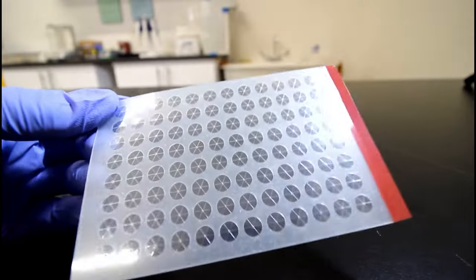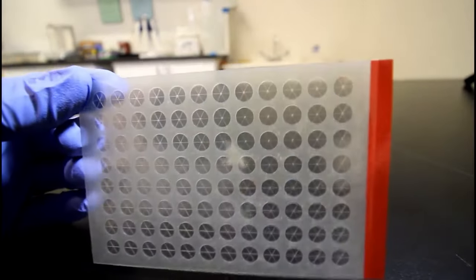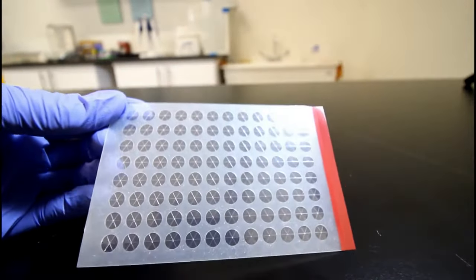The slit seal is a pre-cut self-closing plate cover for 96 well plates to prevent solvent evaporation and cross-contamination.